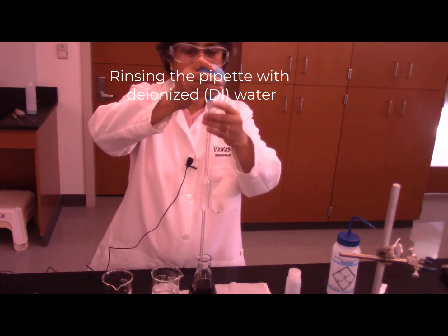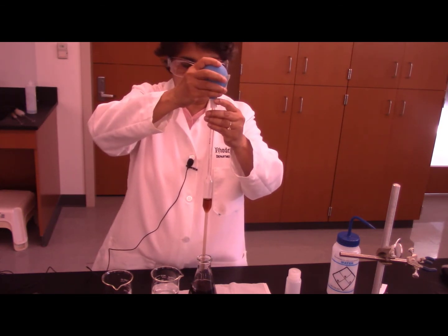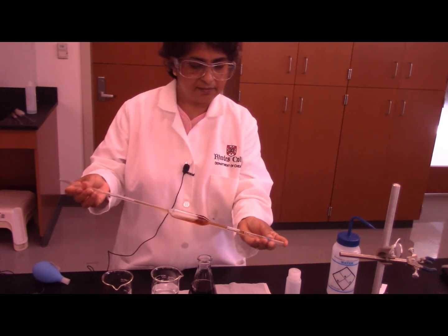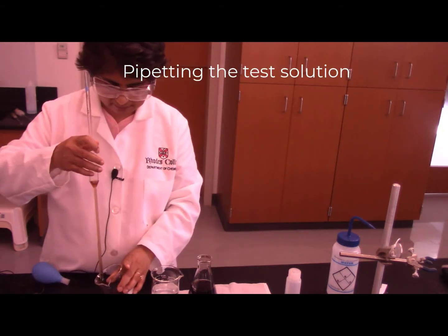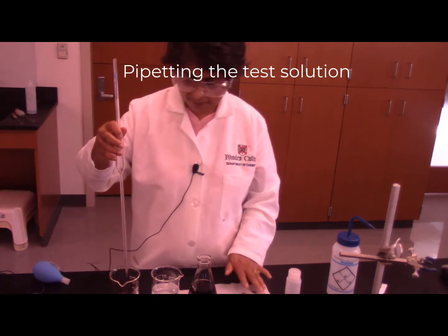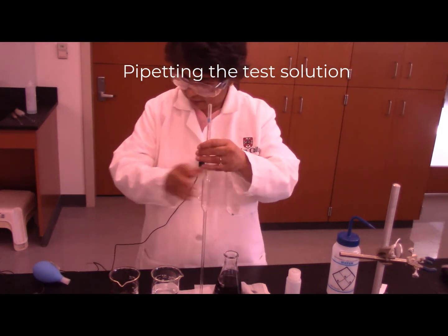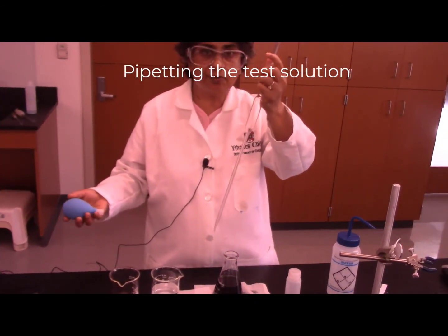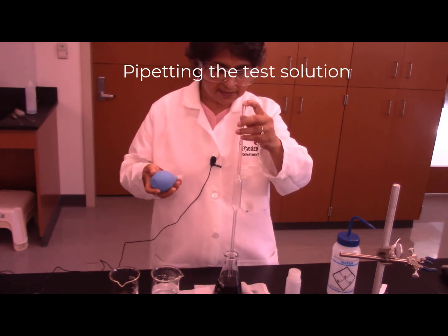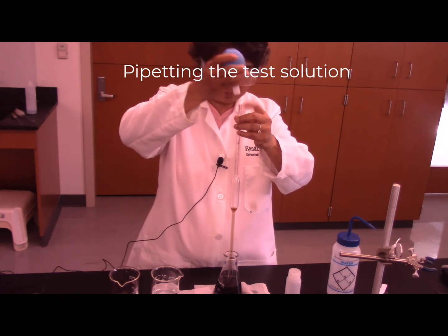Next I am going to rinse the pipette with the test solution. I will use the same tip rolling method to rinse the pipette with the test solution. Now my pipette is all conditioned. I am ready to pipette the test solution. I am immersing the pipette in the test solution, or the Diet Coke solution. Make sure that the pipette stays straight in the solution.